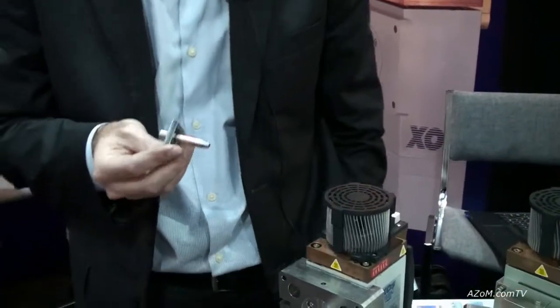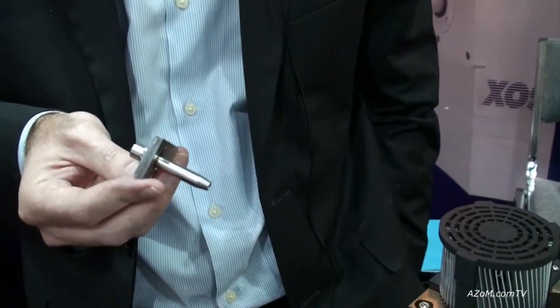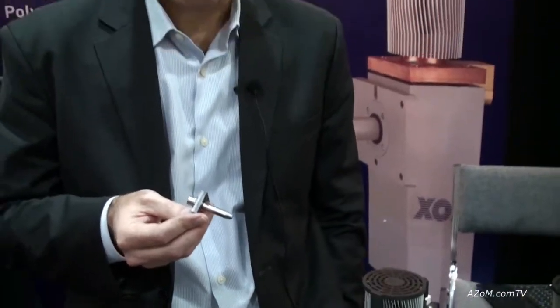As the name implies, X-Ray Optical Systems among other things makes X-Ray optics, and one of the X-Ray optics that we're showing here at this show is what we refer to as a polycapillary optic. Polycapillary optics allow X-Ray analyzers to analyze much smaller features with much better sensitivities than systems that would not use a polycapillary optic at all.